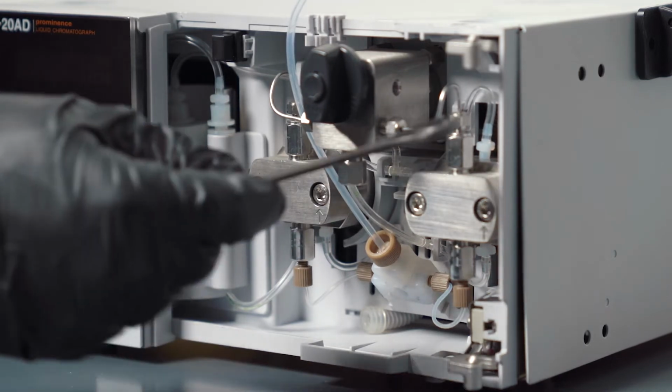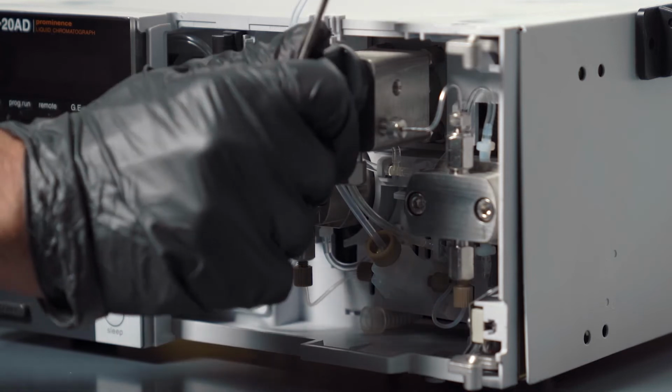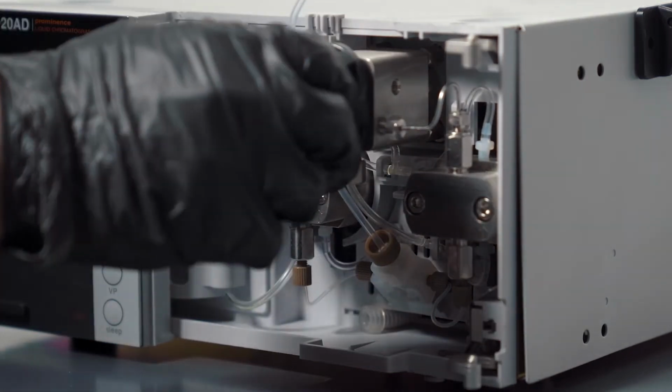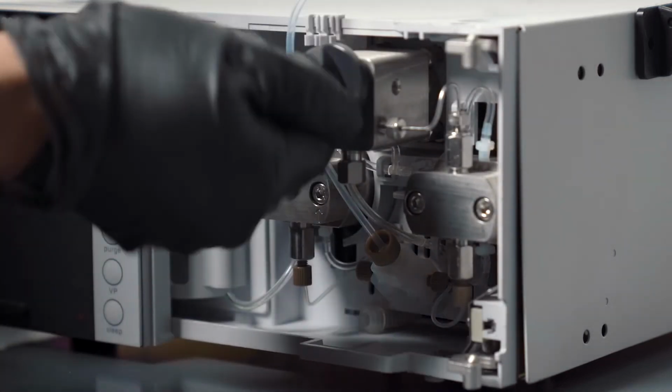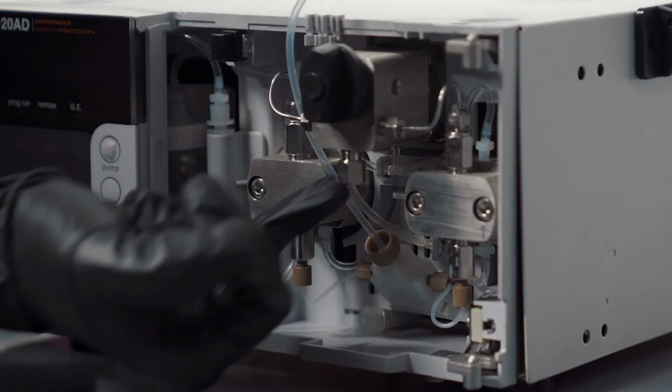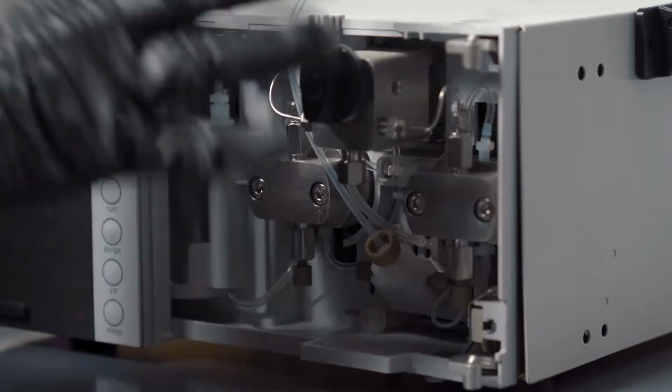And then both of the solvents combine here. And this is a drain valve. So if you open it, there you go. If you open it, then this is your waste port. So it goes out to waste from there. And when you close it, it comes out of here and goes to the auto sampler. That's how this pump works.